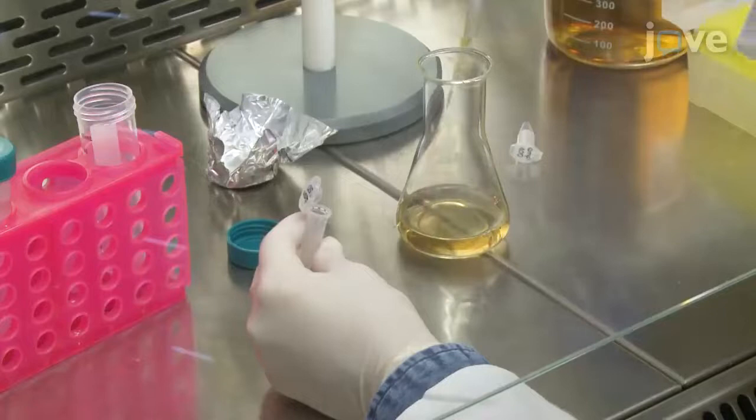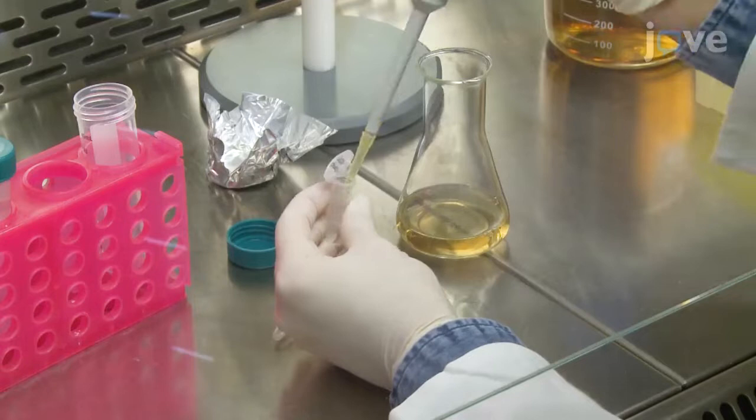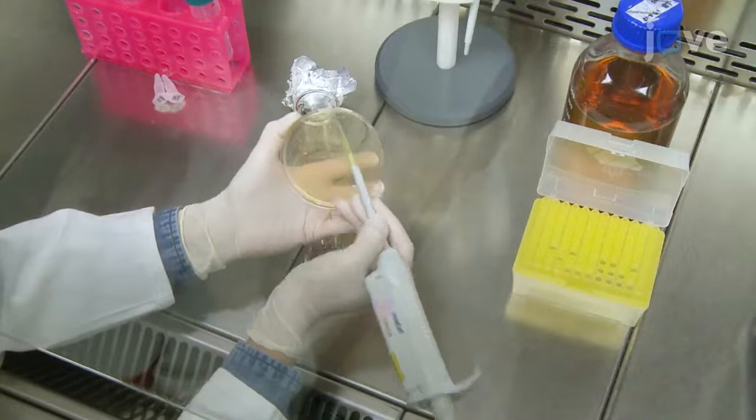To begin this procedure, prepare 25 mL of LB medium containing antibiotics and 1% glucose in a 100 mL Erlenmeyer flask. Inoculate it using a colony of freshly transformed bacterial cells or cells from a frozen cell stock. Incubate the cells overnight at 37 degrees Celsius and 200 RPM.